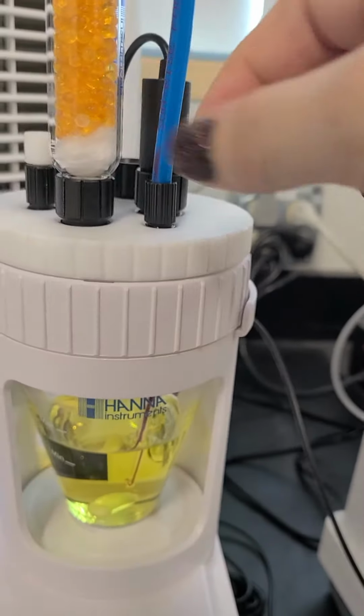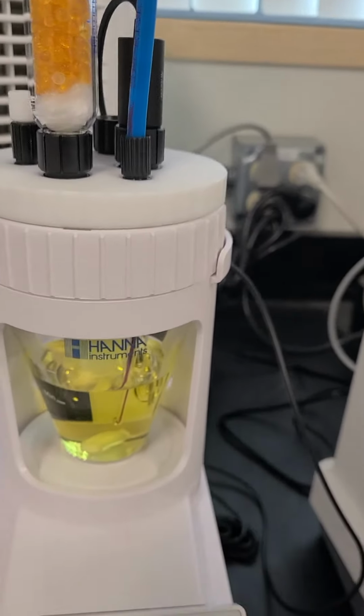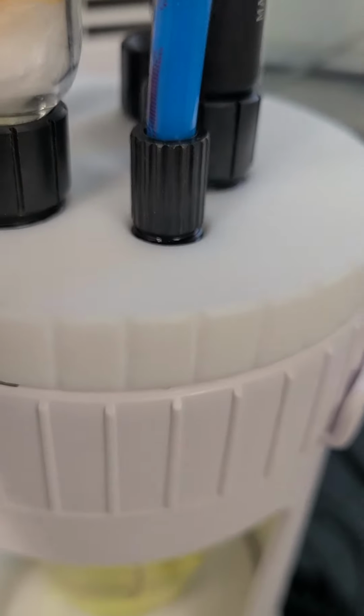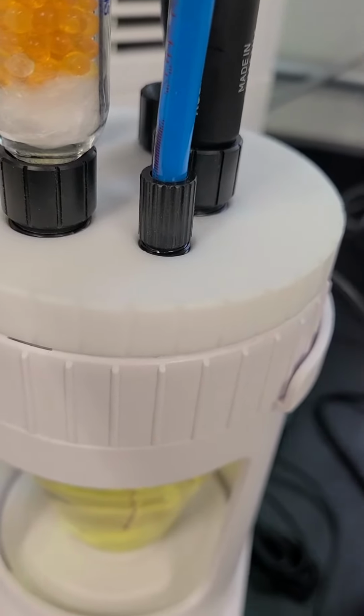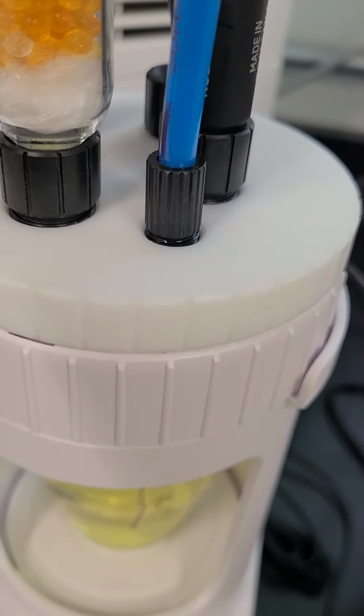We have undone it and redone it to see if maybe it was like a seating issue, but that doesn't seem to help. But it is right there where it normally leaks out. So I'm gonna go ahead and turn this on. Give it a second.